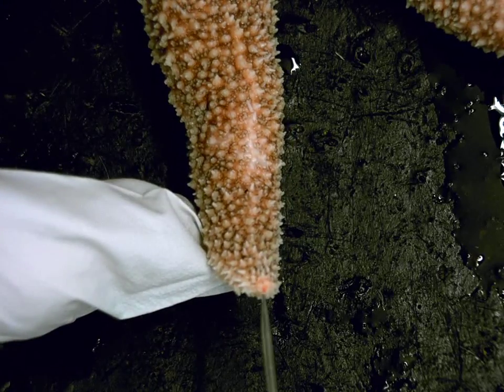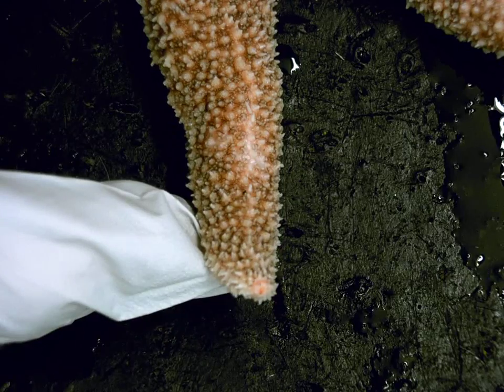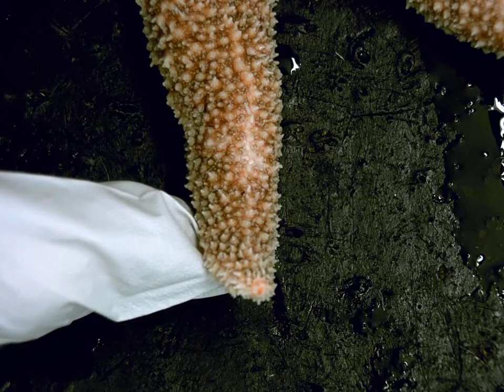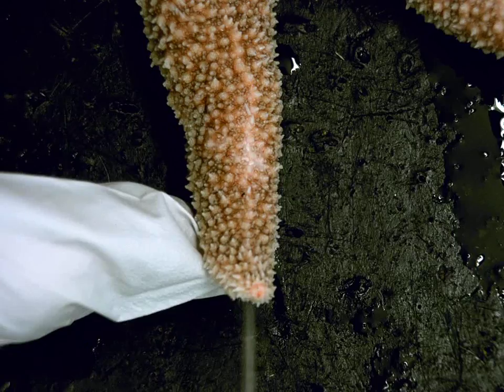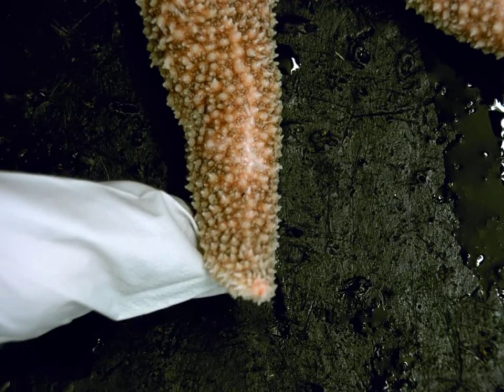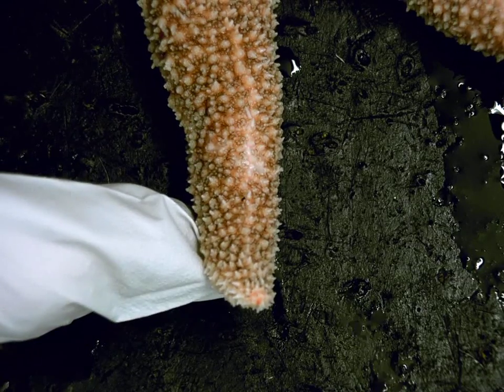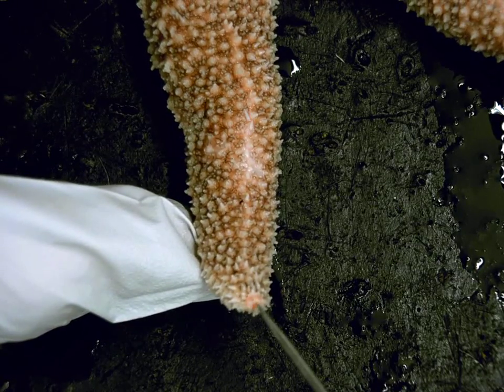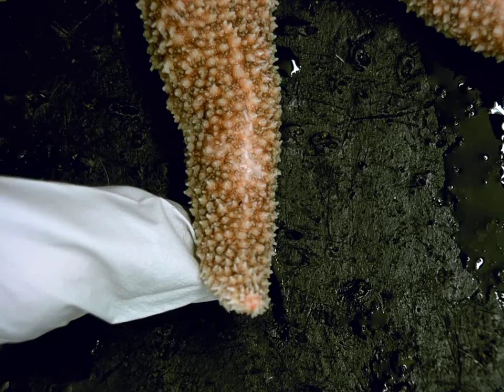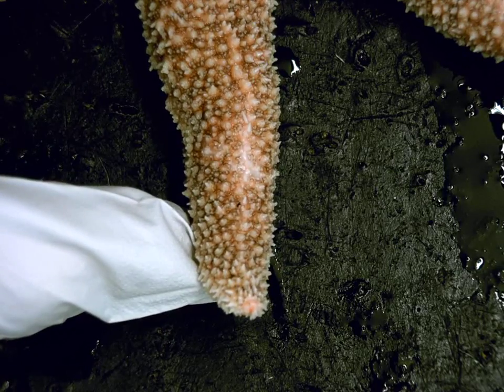And we can see right at the tip there's kind of this red dot. Now that red dot is actually the eye spot. So that's going to be just like an eye spot in every animal group we've studied, which means not image focusing. No seeing of an image, but definitely light sensing. Now the other thing is there are specialized tentacles that would be found in this area as well. We just can't see them clearly in this one.